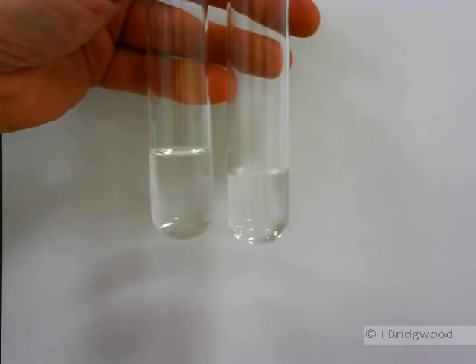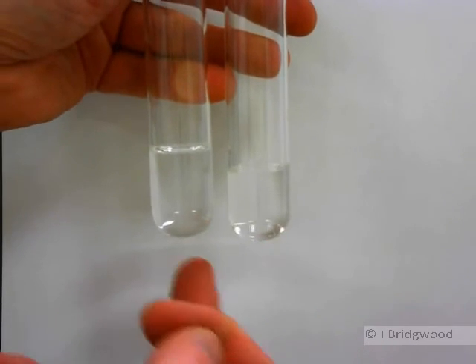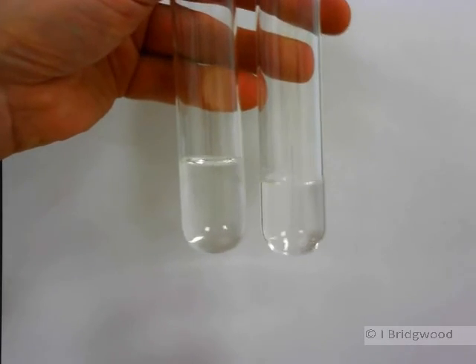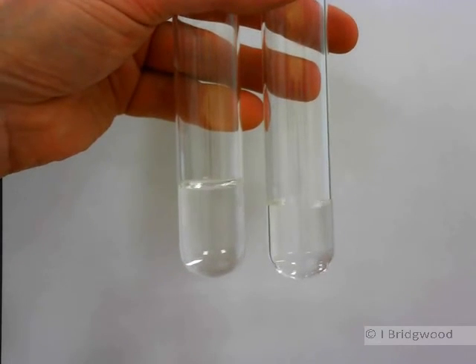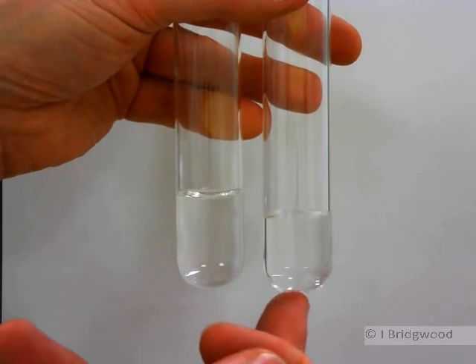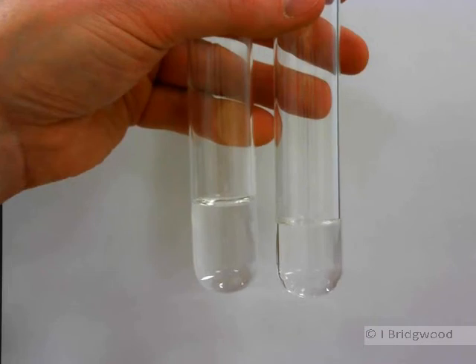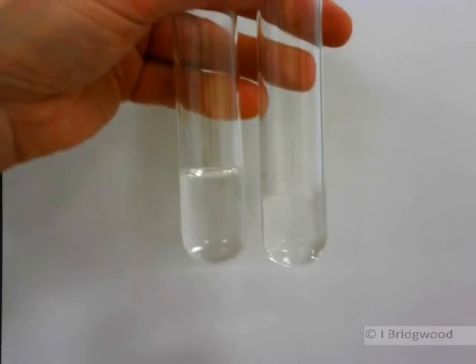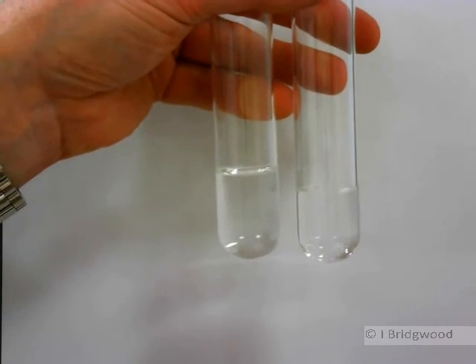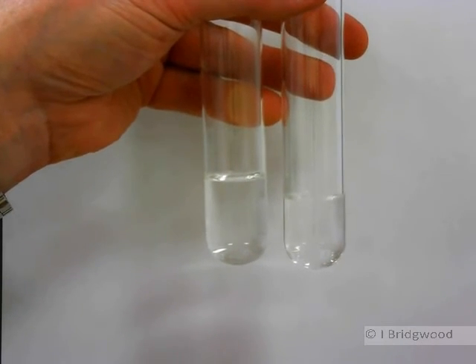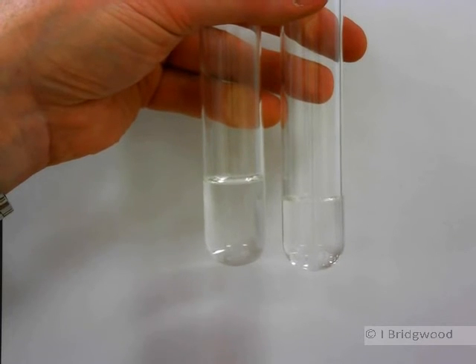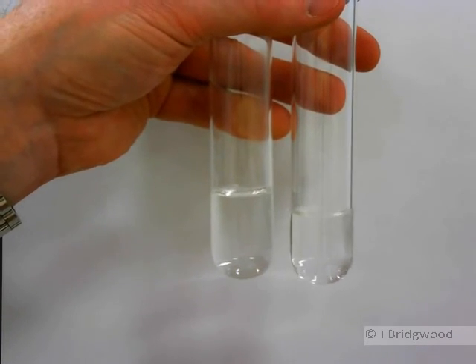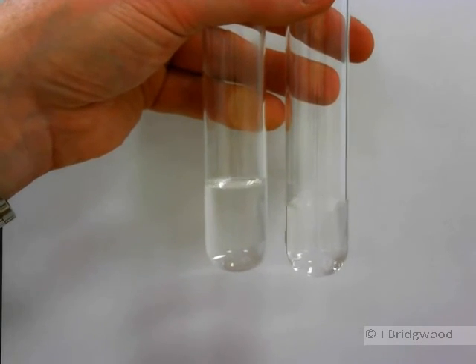Here we have two colorless liquids. Propanone and water. Now in terms of the intermolecular forces that we have here, water has hydrogen bonding extensively, propanone-dipole-dipole interactions. So when we mix the two, we will be breaking dipole-dipole interactions with the propanone, and breaking hydrogen bonds with the water. And the interactions that we form between propanone and water will be hydrogen bonds.